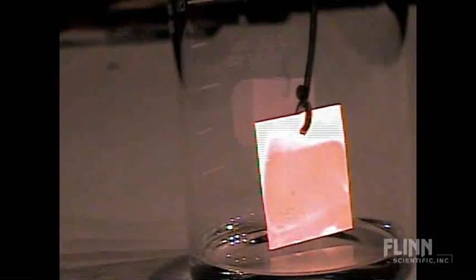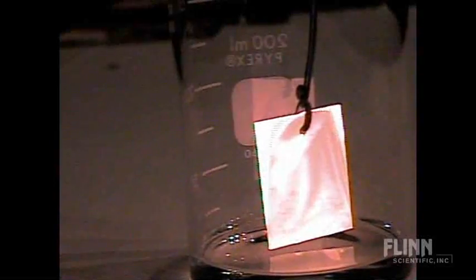Now you can get a lot of mileage out of this demo for organic things or for catalyst things. Because what's going on right there in the beaker, and it's even more charming up here, but believe me you don't want to touch it. The acetone is turning into an aldehyde, and it's a surface catalyst with the copper. So as the copper catalyzes the acetone, it's an organic reaction too, you get to go from a ketone to an aldehyde. And if you were standing where I am, you would smell the wee bits of formaldehyde coming off of this.